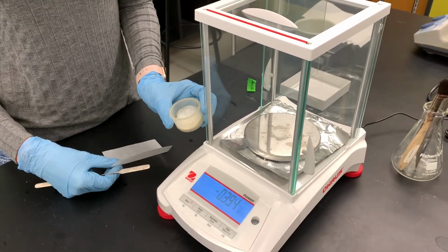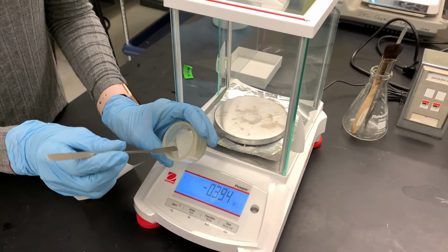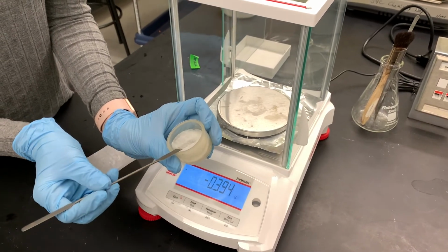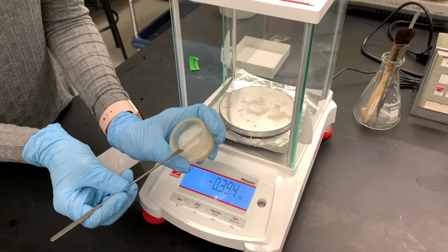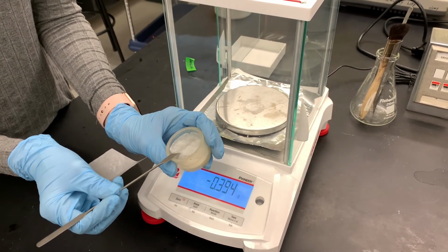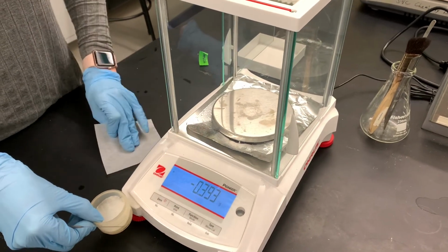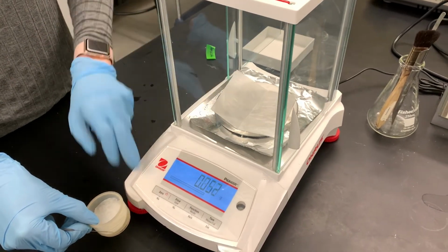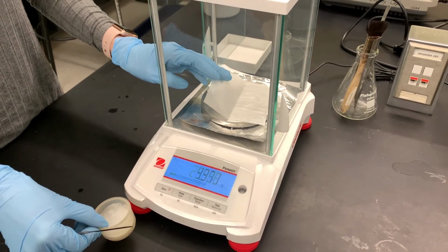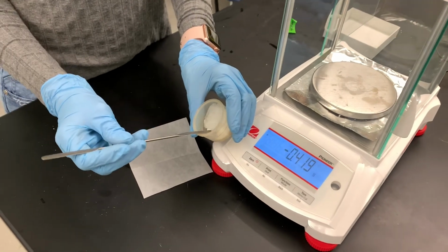Our product has been drying for quite a while, and I don't know how well you can tell, but it's like a solid, almost looks like the filter paper here. Like it's dried in this really solid piece that I'm gonna try to keep intact while I weigh it. I'm gonna start by tearing this piece of filter paper, or weighing paper. We're gonna weigh it out on this piece of paper.